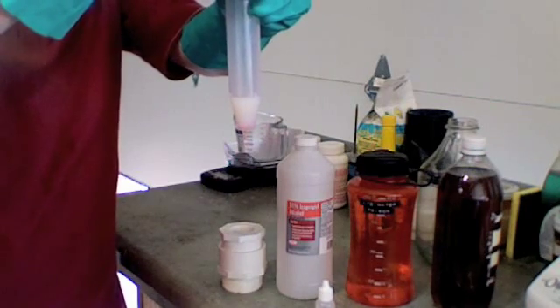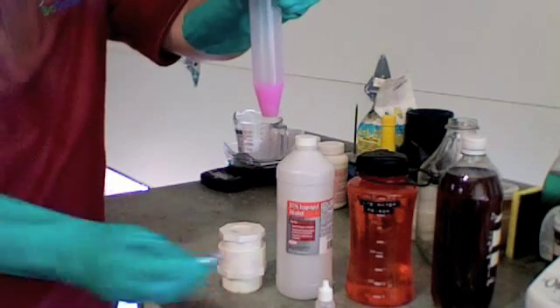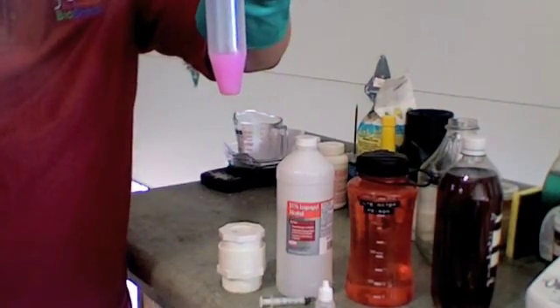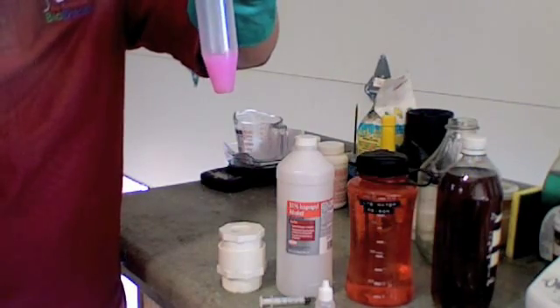Stays longer. There's two point zero. That's exactly what our titration number is, it's two point zero. Next, we'll go on to processing the small batch.